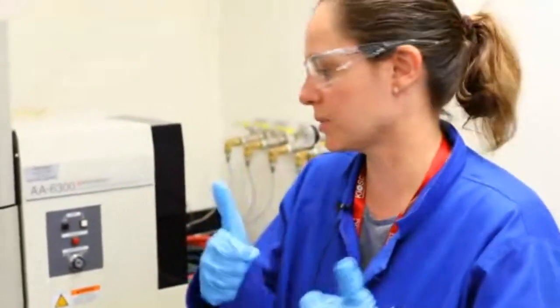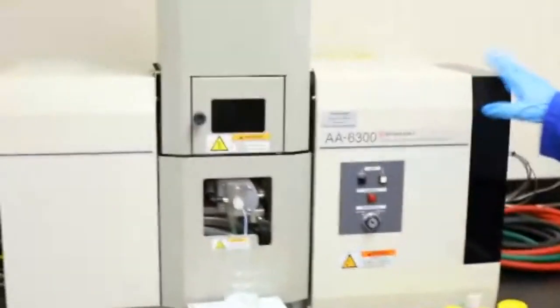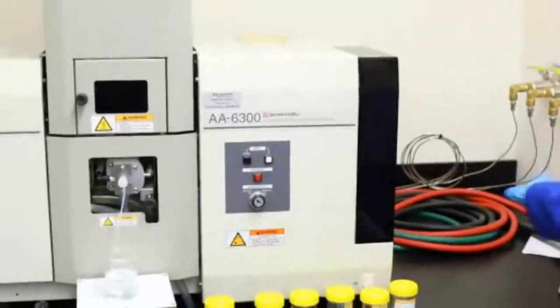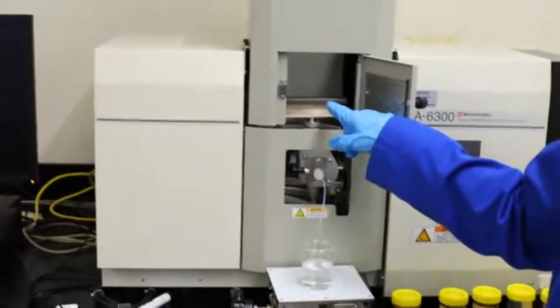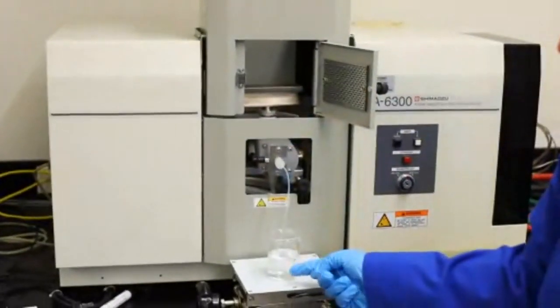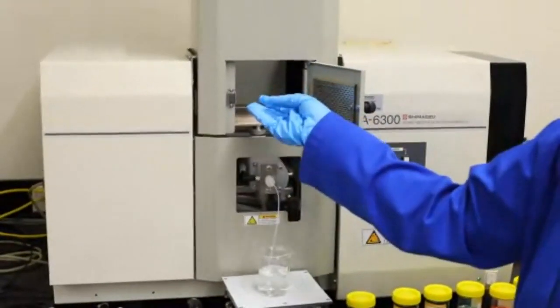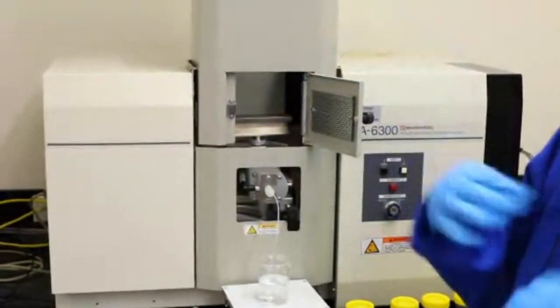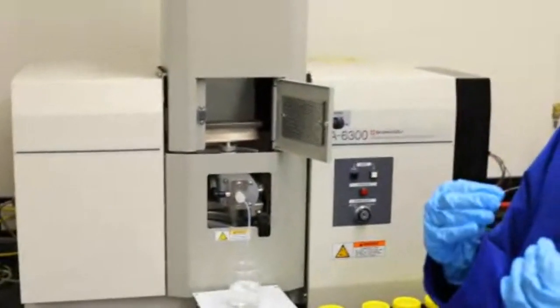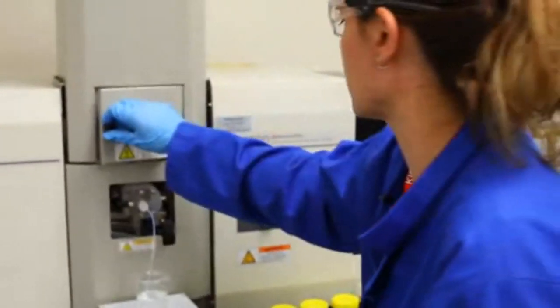Okay, did anyone give us what the AAS stood for? Awesome work. All right, so here we have our AAS. I just want to show you, we've got our gas lines here, and that feeds into here. So we have our burner set up here. What happens is our sample is sucked up into the machine, and then with our gas burning here, of course I don't have it alight while my fingers are in it, it will burn that substance. If there's a metal present, that's where you'll get it being excited, and when it gets excited, that means we'll have colours coming out, our electrons moving around.